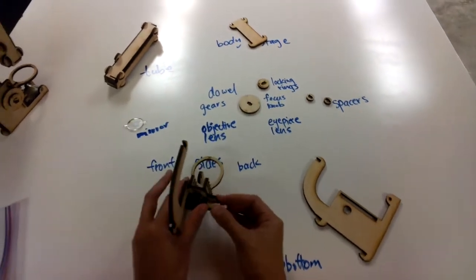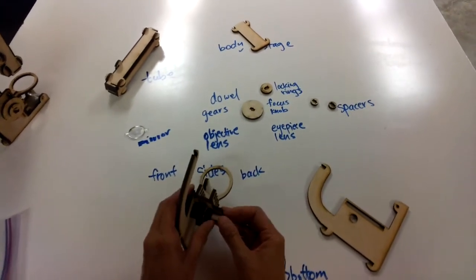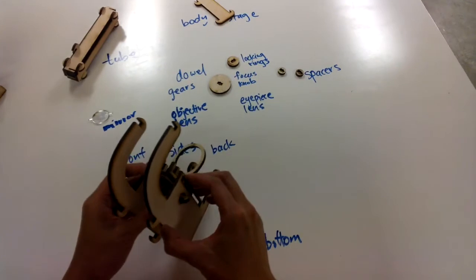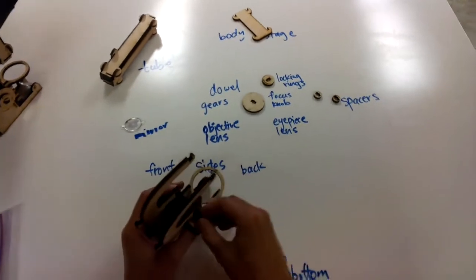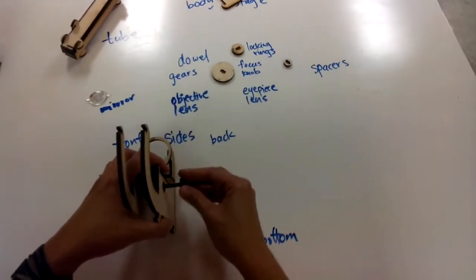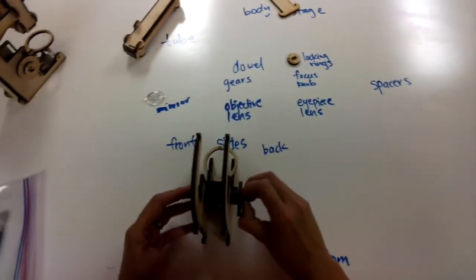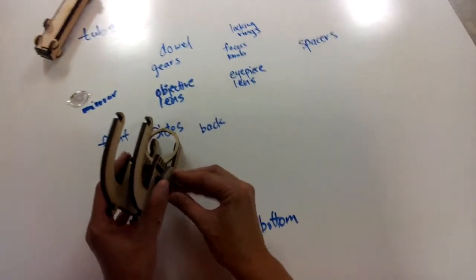So now you've got your dowel that has the locking ring, the spacer, the body, two spacers, two gears, two spacers, and then the stage is going on this little rail here. And now you're going to add the final piece here. So now you kind of see how you got a microscope. Okay, so we're going to add on the rest while trying to keep all of this together. We're going to add two more spacers on the outside of the body. Then you're going to add the big ring, that's your focusing knob. Okay, and then finally one locking ring to lock everything into place.